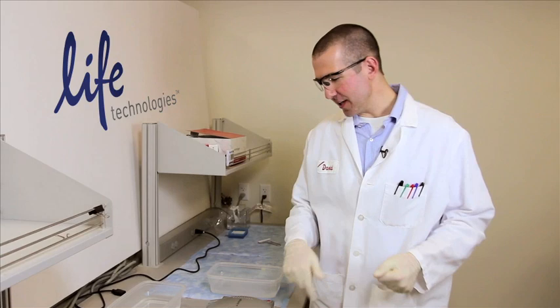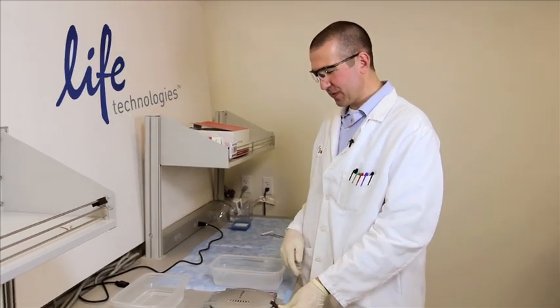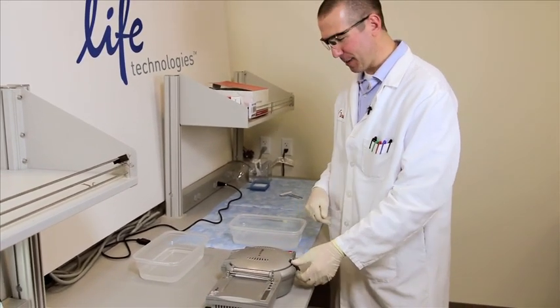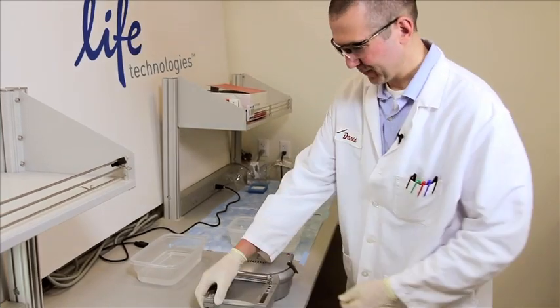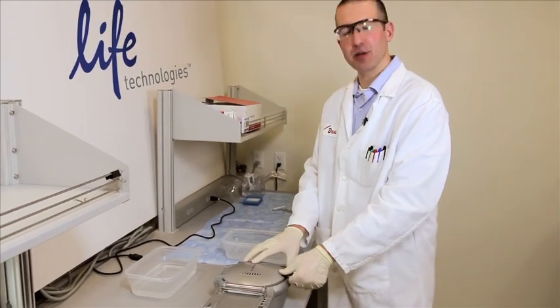Okay, that sound is the completion of our seven minute iBlot transfer. Let's go ahead and take down the iBlot stack.